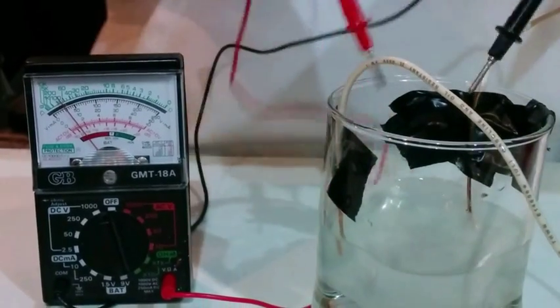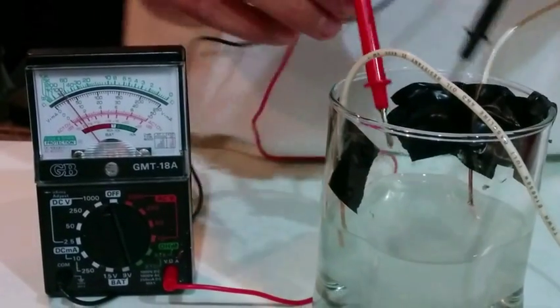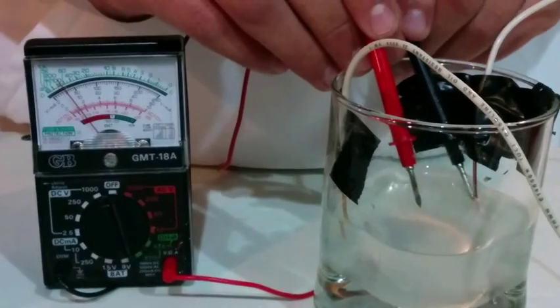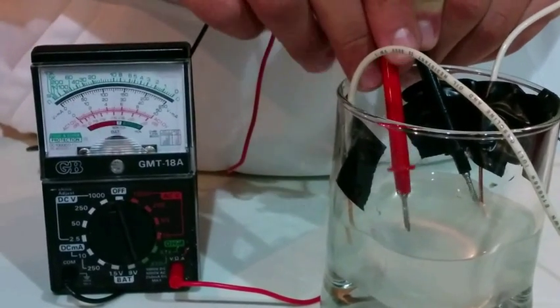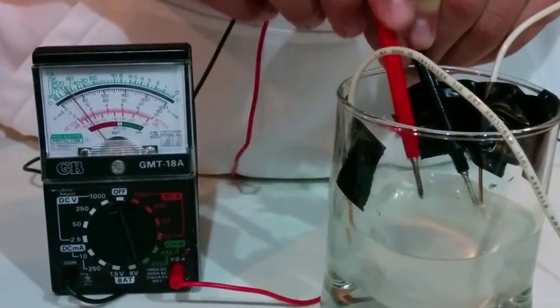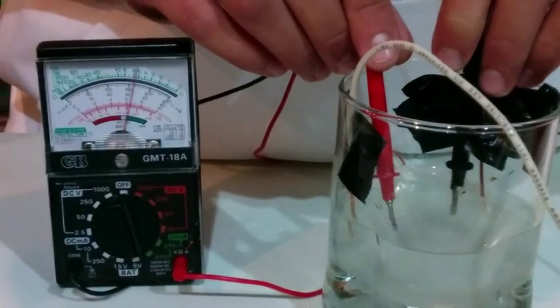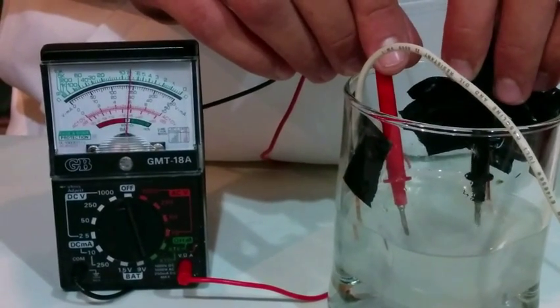You can hear a sizzling too, probably not on the camera, but that means there's a connection. And if I do it with the other side, the connection got a little bit stronger.